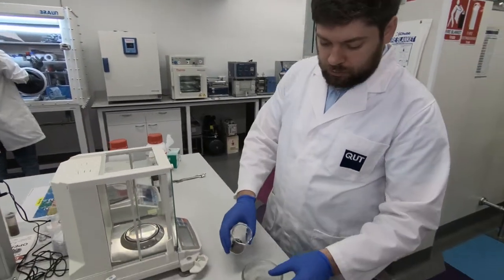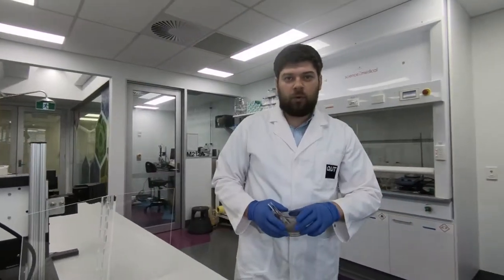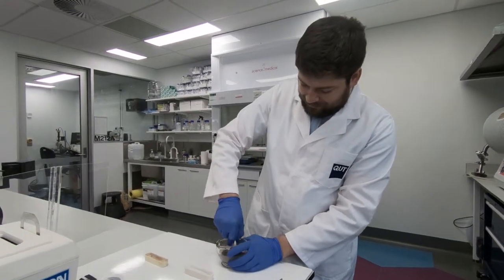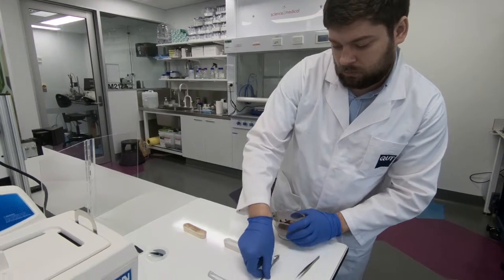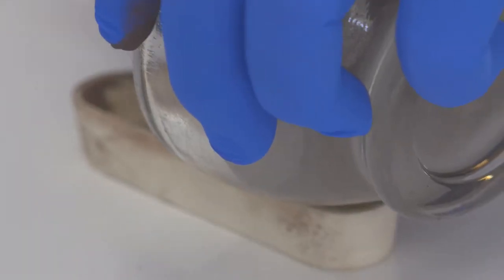Then we transfer it here. Now when we have our powders ready, we can mix them a bit, and then transfer it to the ceramic bowl. I do carefully and try to distribute powder uniformly in the bowl.